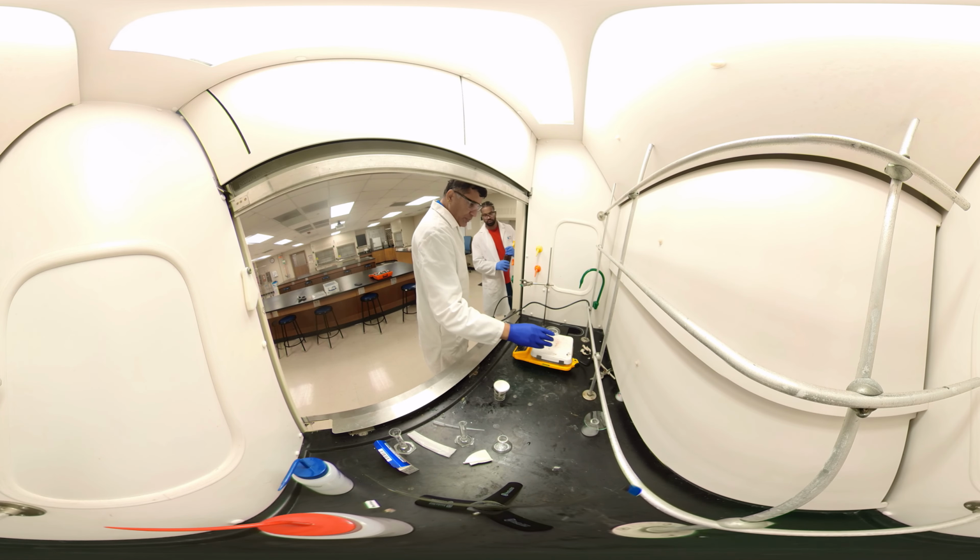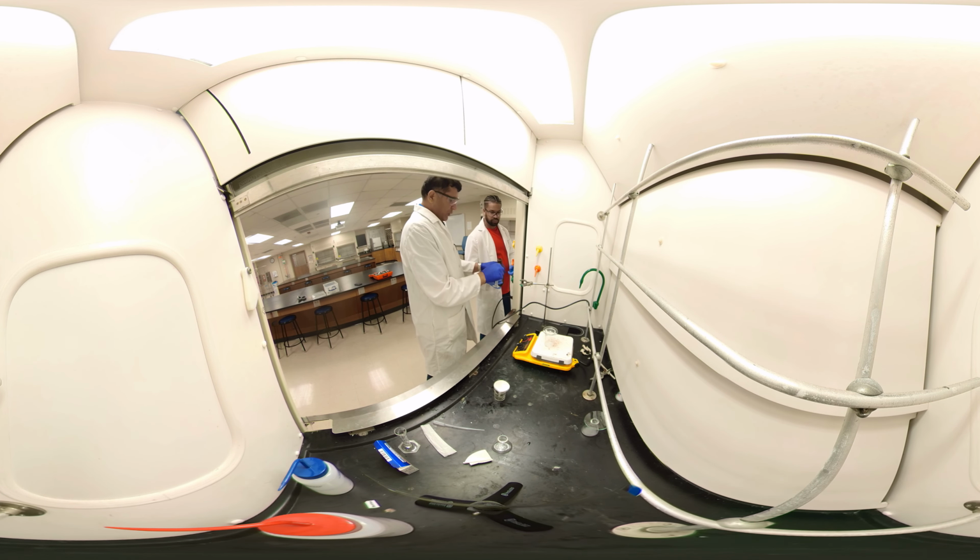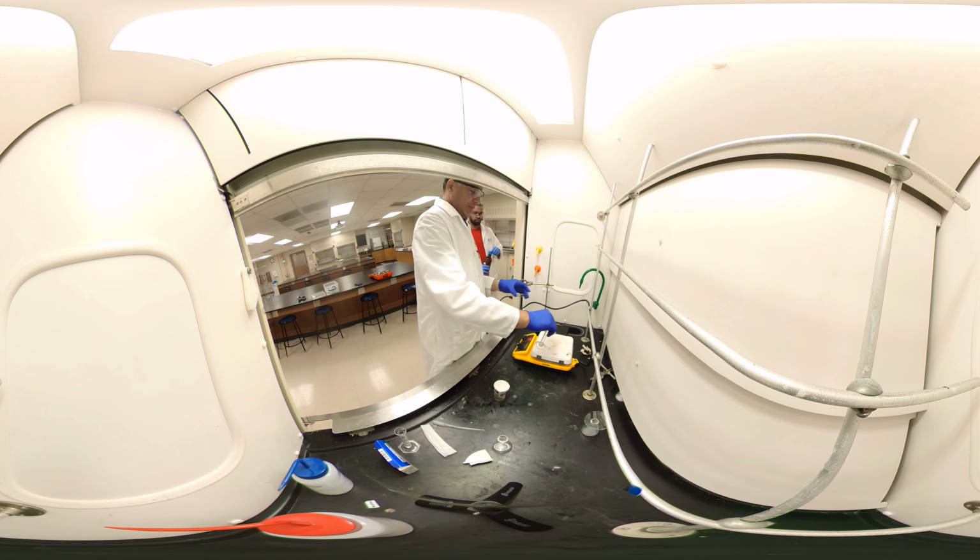But I think that's good. It's dissolved maybe. That's the ethanol actually. The 1 milliliter I'm going to add it. Let's evaporate it, so I just want to balance it.